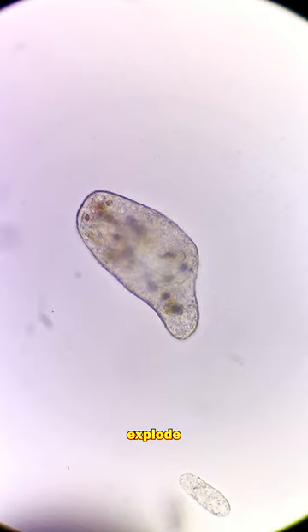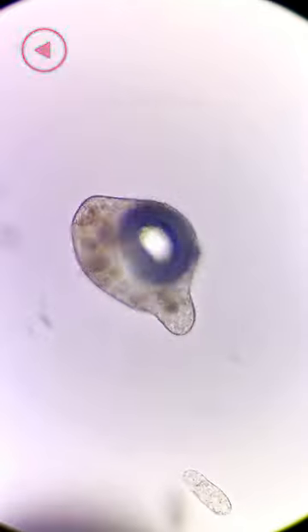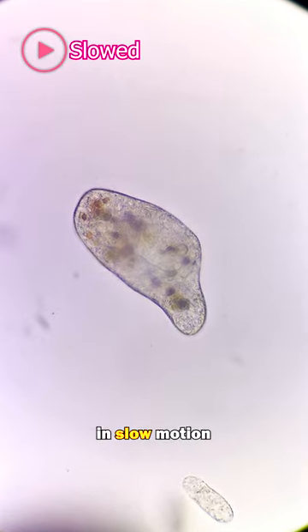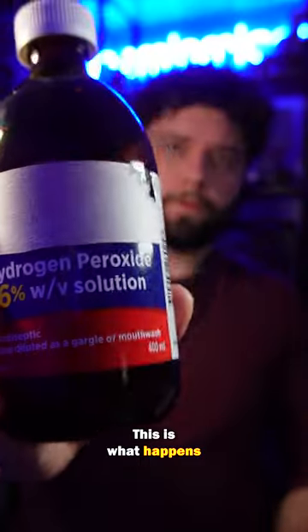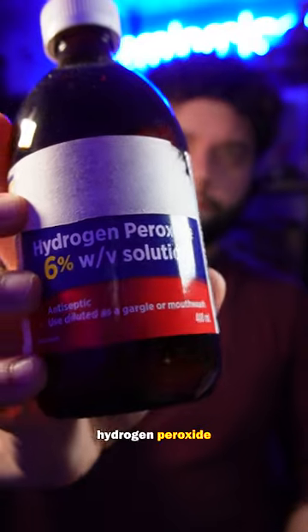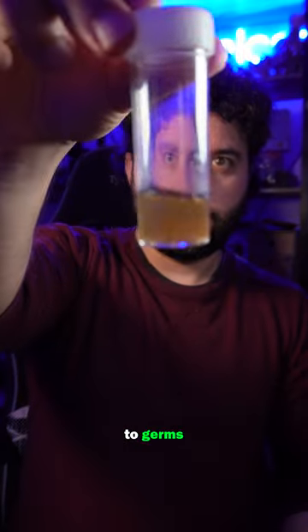This cell is about to explode. Let's watch this in slow motion. This is what happens when you add hydrogen peroxide to germs.